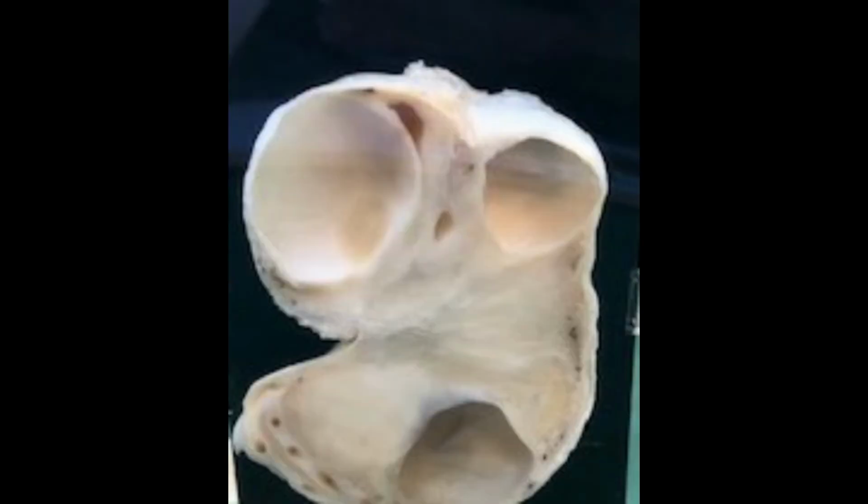So what I'm going to show you next is a horse's ovary, and you notice three large empty vesicles. Now these are follicles. This ovary has been cut in half and the fluids have come out, but this horse would have had three follicles. Anyone that knows a little bit about horses knows that you rarely get triplets, and twins don't often survive. But even if this horse did ovulate three eggs and they were fertilized, usually by day 20 they normally end up with only one live embryo anyway.